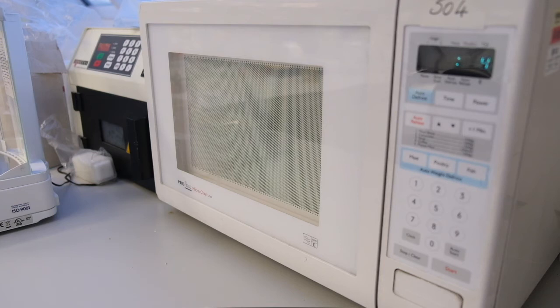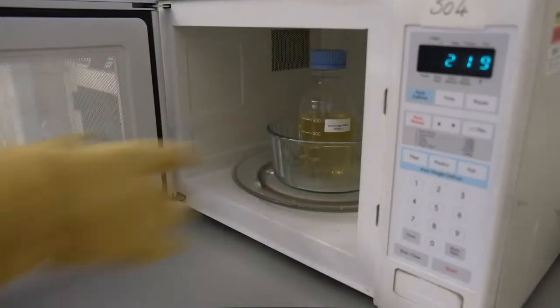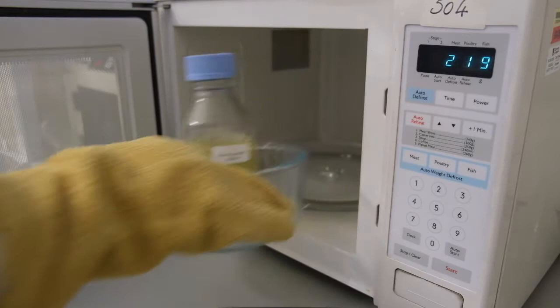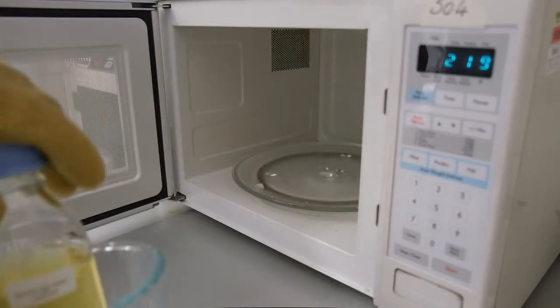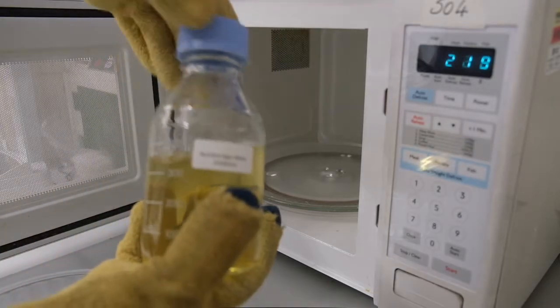After 14 minutes, the agar should be done. Wearing protective gloves, carefully take the agar out of the microwave. Take great care as the agar might boil over, suddenly releasing steam.